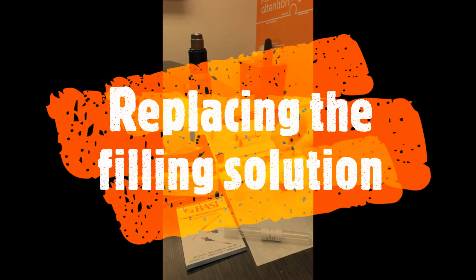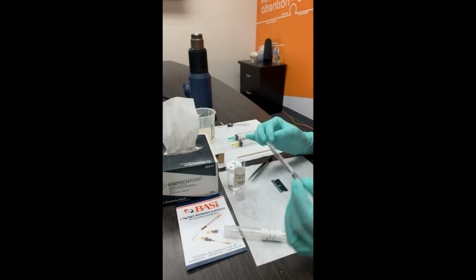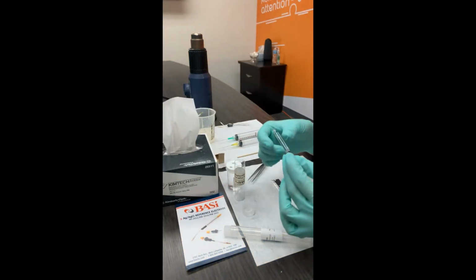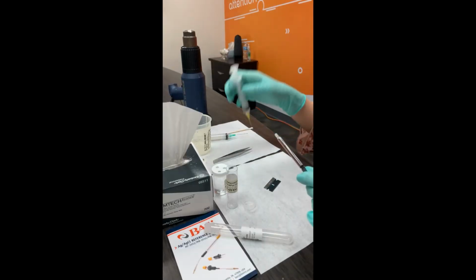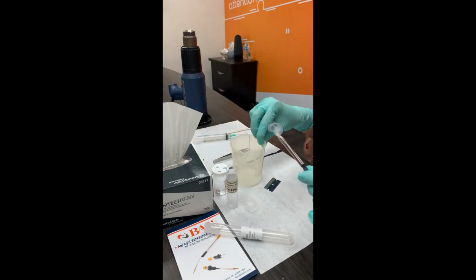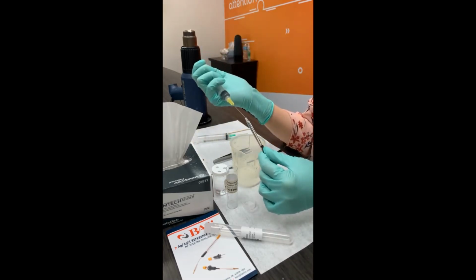Sometimes your solution may also be contaminated, right? And if that happens, you may want to replace it with a fresh solution of 3 molar sodium chloride or potassium chloride, again, depending on what you're using. You can use your syringe needle to aspirate or remove the solution out of the electrode.